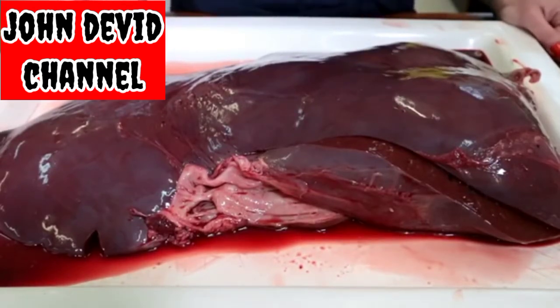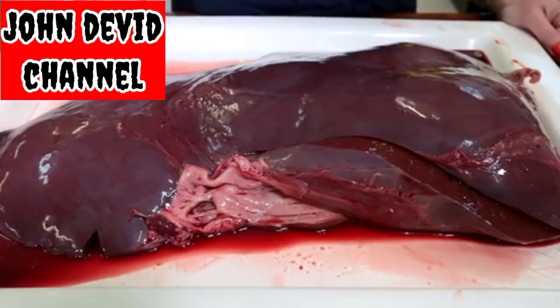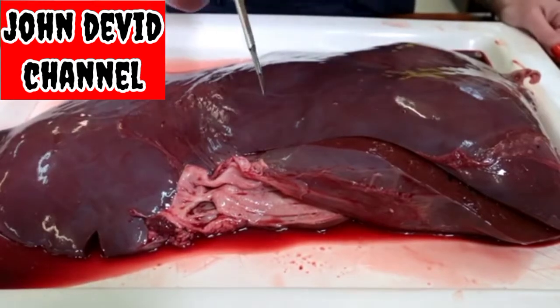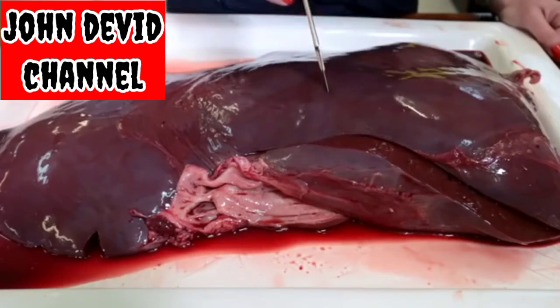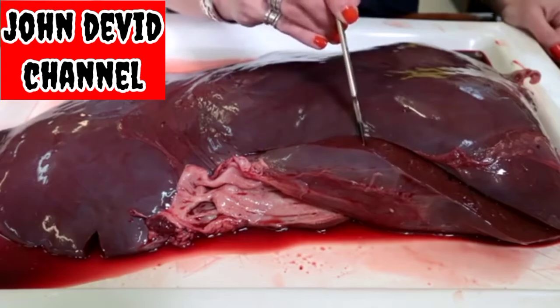Another function of the liver is to detoxify harmful substances, one of which is hydrogen peroxide, which is naturally produced in the body. We can show this by removing some of the liver tissue and having a chemical reaction with the hydrogen peroxide.